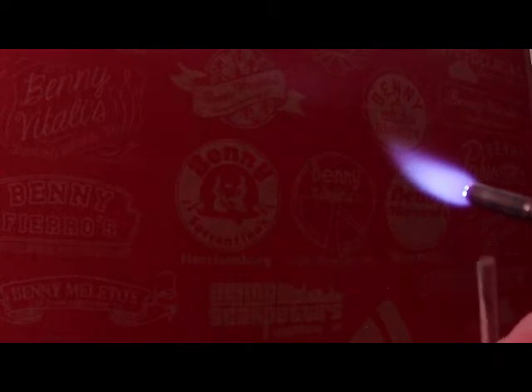When all is said and done, for the working piece, the sample tray, I took it and annealed it, put it in the annealing oven, and that removed the stress. In this case, I'm not even going to bother with, say, a torch anneal, because I'm not really concerned about this becoming anything. So now what I'm going to do, and I really should clean the end of this glass rod, because it's not even fire polished, but I'm not going to worry about it.